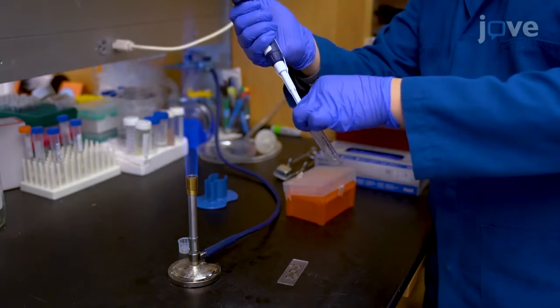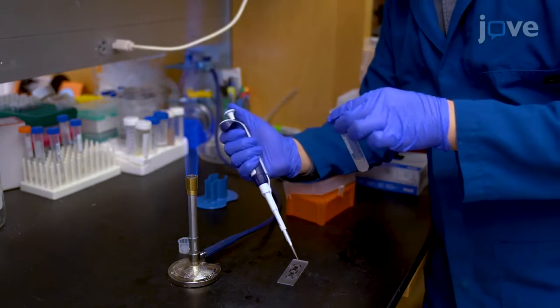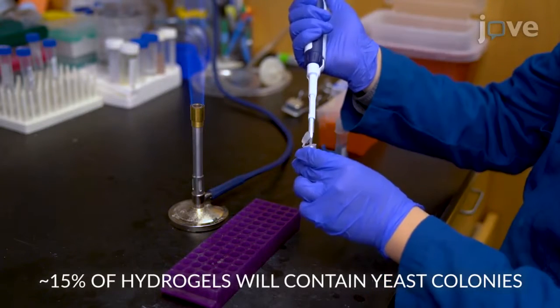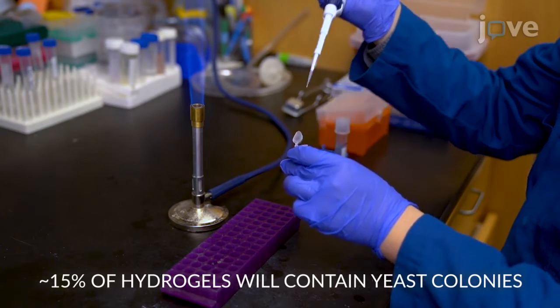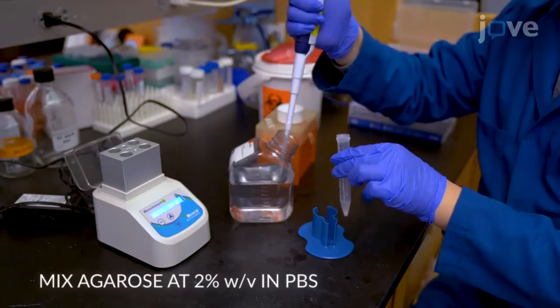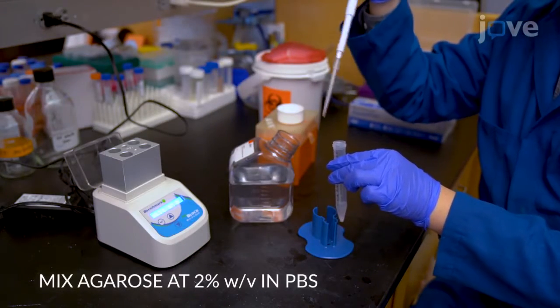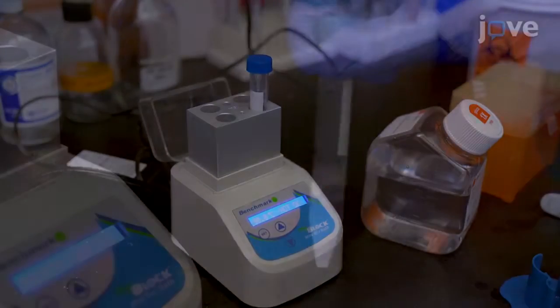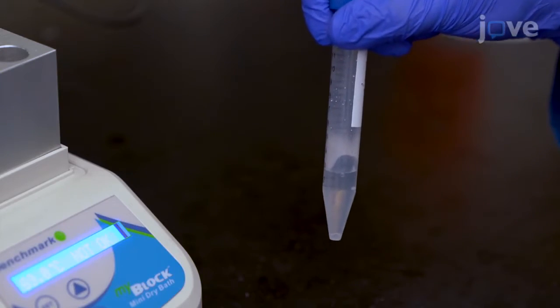Obtain yeast from a suspension culture and count the cells using a hemocytometer. Resuspend the cells in PBS at a concentration of about 750,000 cells per milliliter. Next, mix ultra-low melting point agarose in PBS and heat the mixture at 90 degrees Celsius until the agarose melts.